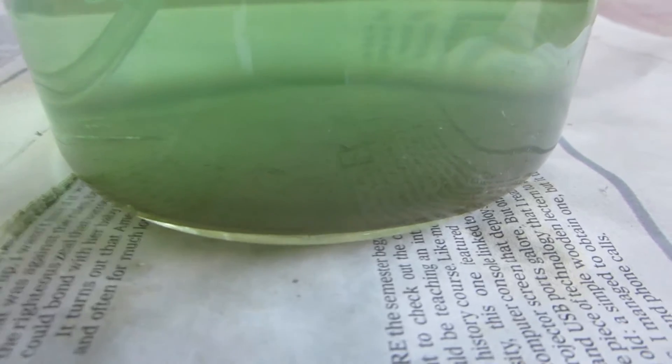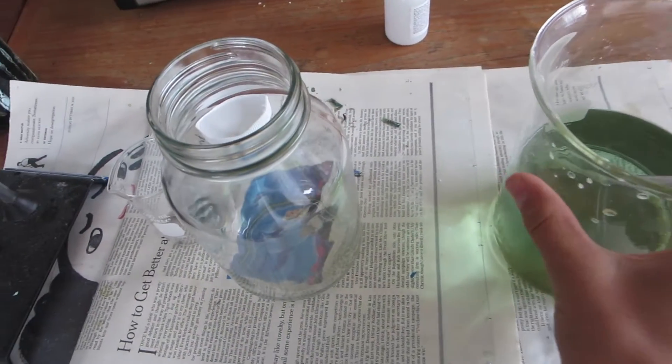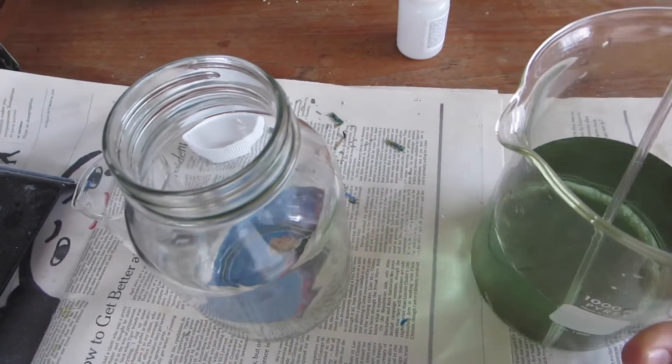The next morning, you can see gold at the bottom. It's not gold-colored yet, but I'm going to pour off the liquid to recover the gold and then melt it down.